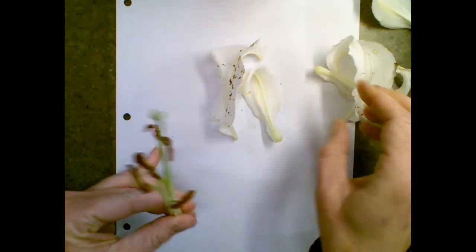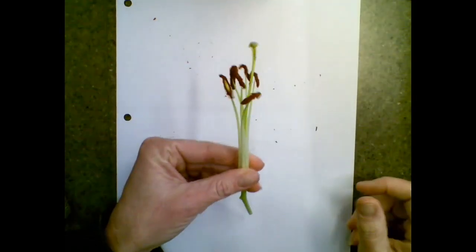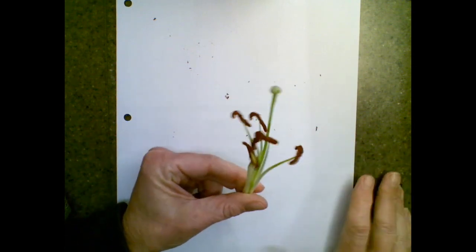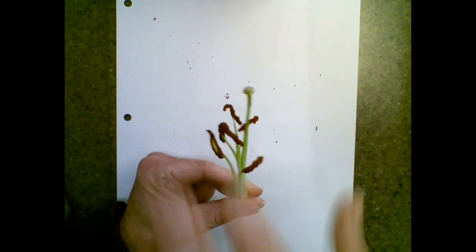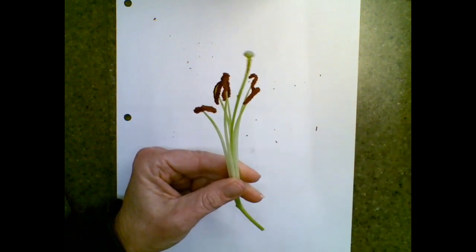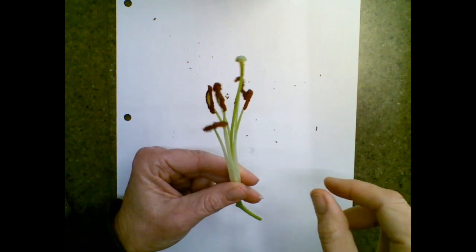There are 6 petals, which have pollen and sperm all over them, which is kind of gross, but that's the point of all of this. Once you pull off the petals, all you have left are the male and female reproductive parts. So those petals smell good and they look pretty so that bugs will come into the flower to help the flower out, because for reproduction, it needs the help of a bug. Plants cannot get up and go anywhere and do anything, so they've got to get things to help them.